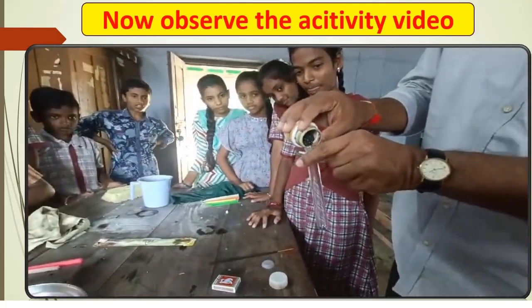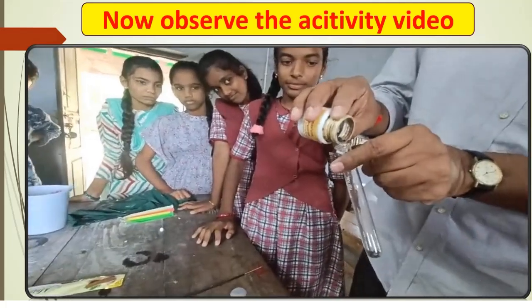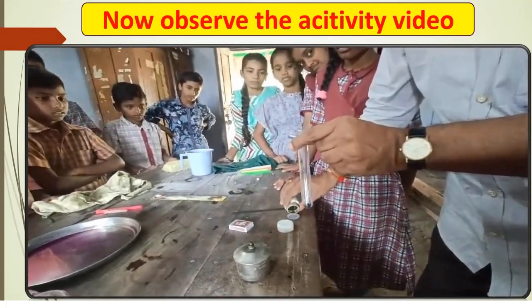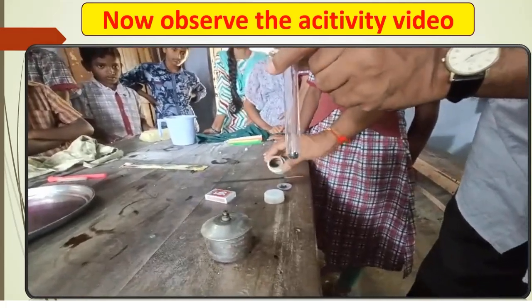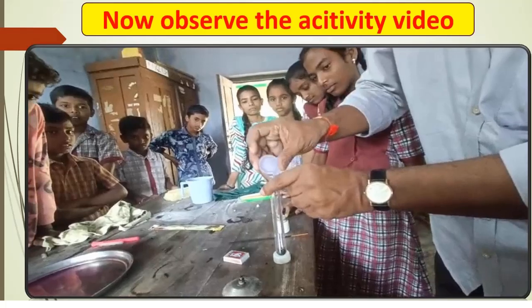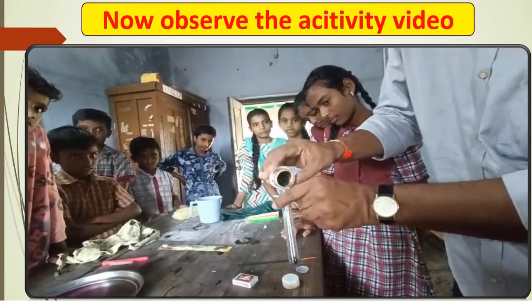Observe here that potassium permanganate generally looks black in color. Take some quantity of potassium permanganate in the test tube.